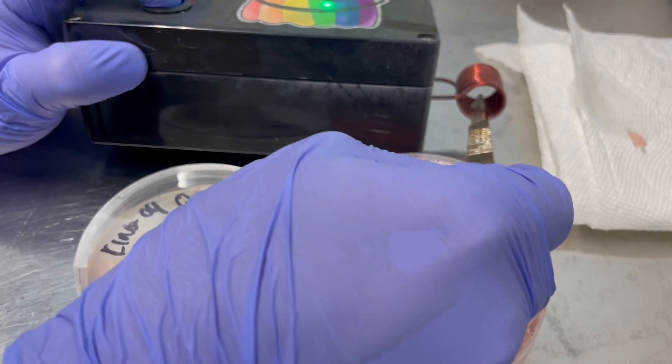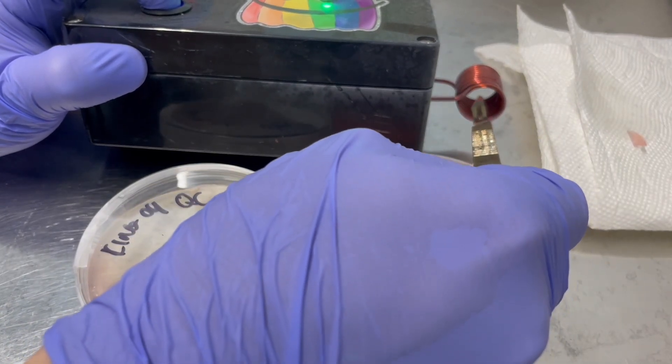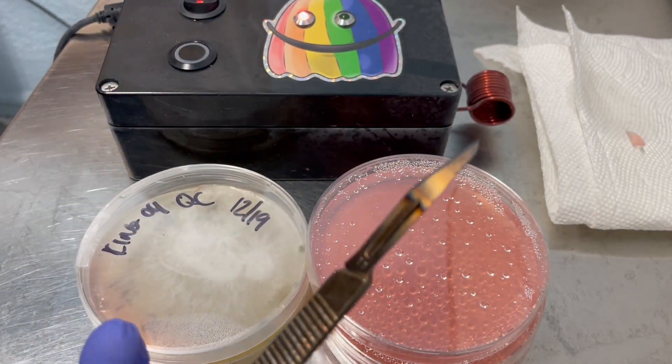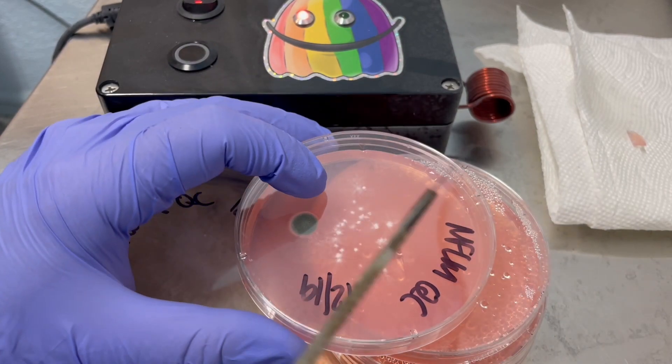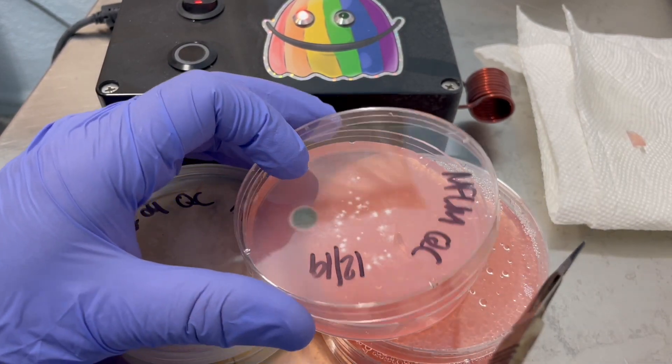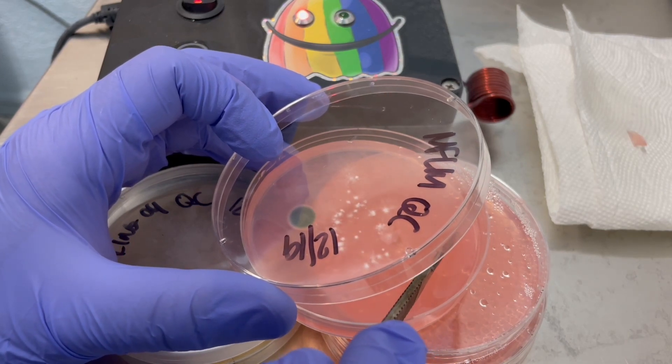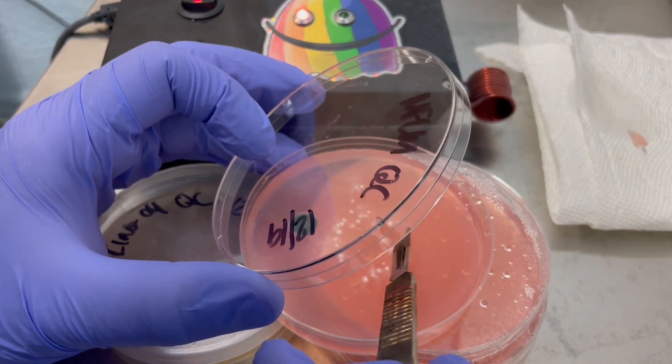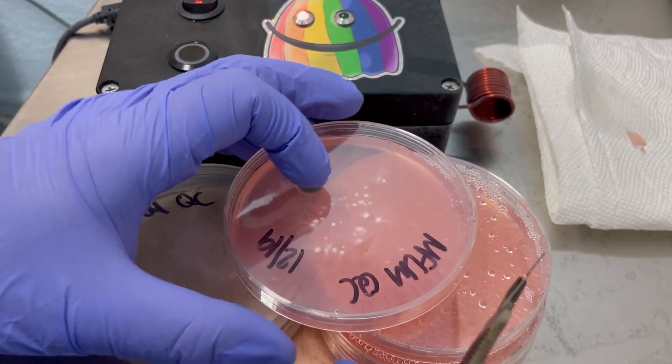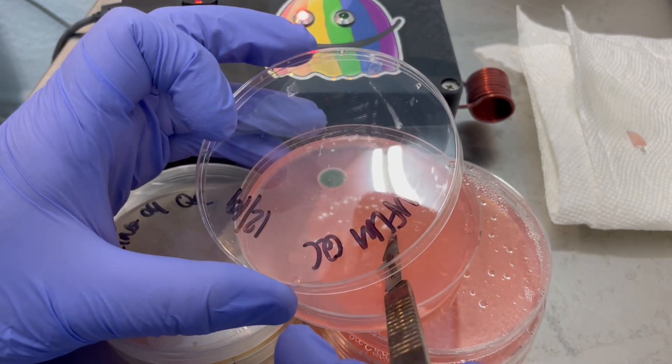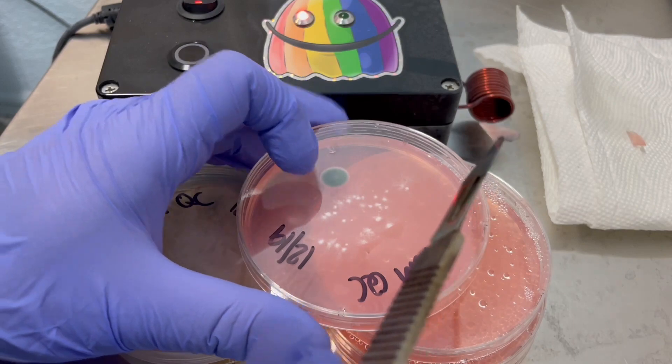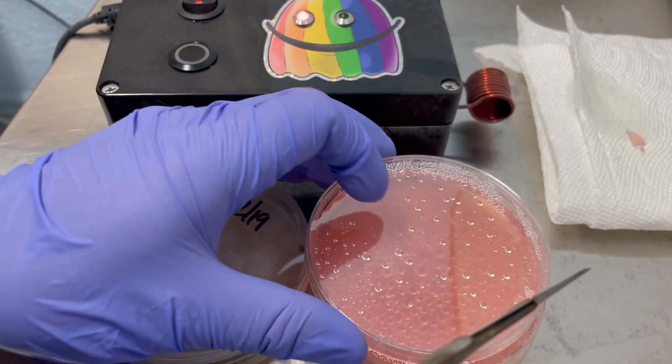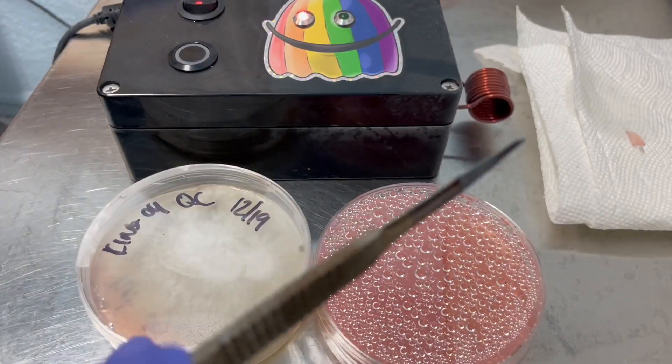I'm just going to re-sterilize this blade with my induction sterilizer so you can see it heated that up. And I'm going to go back in for another one. So don't rush your culture work. Let's try this again. So that will be my lion's mane.